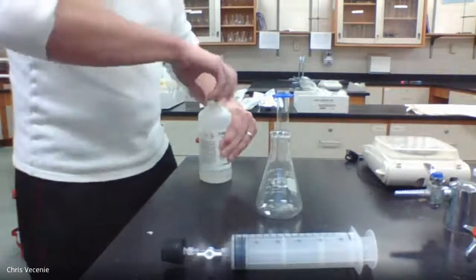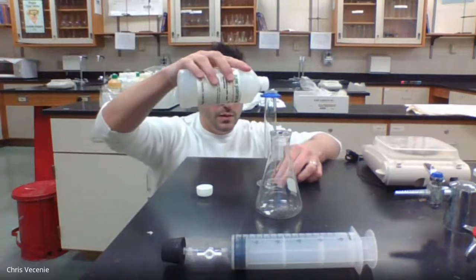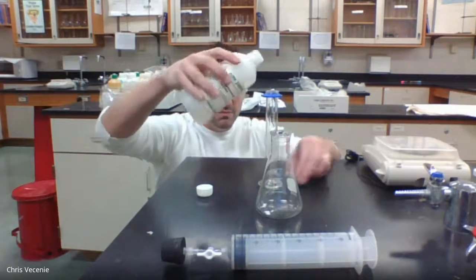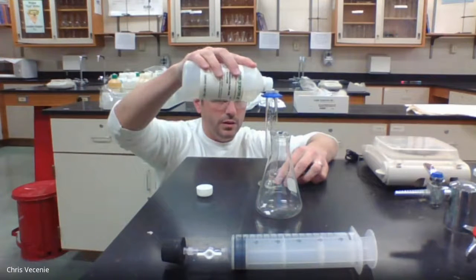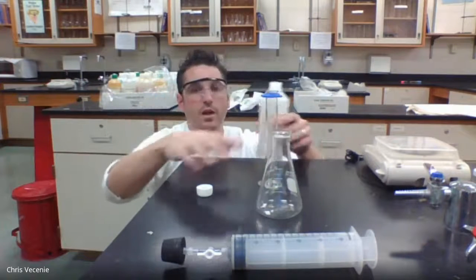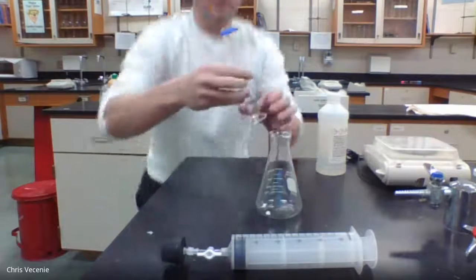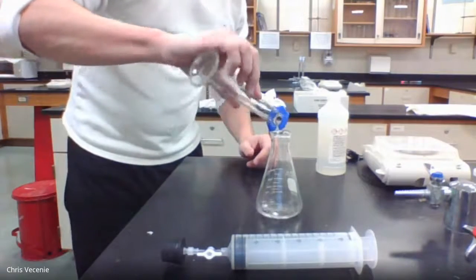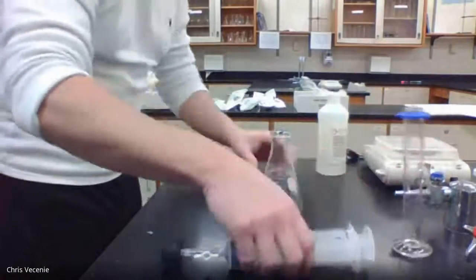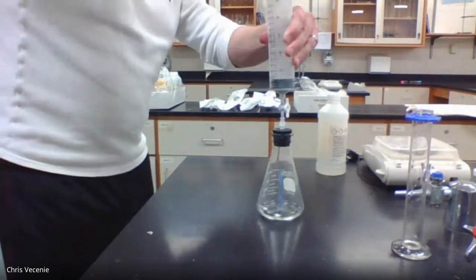Measure out my 10. A bit more. Okay, all right, so I've got my 10 milliliters of my acid there, and now I'm ready to initiate this reaction. So we're going to go ahead and do that. And right away, you can even see it fizzing. Put that on, pull up, push down.